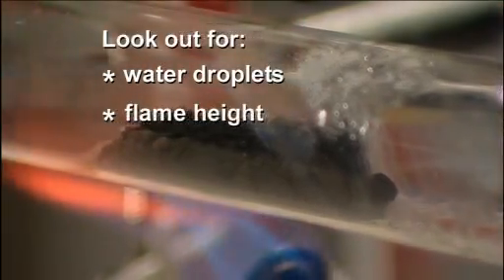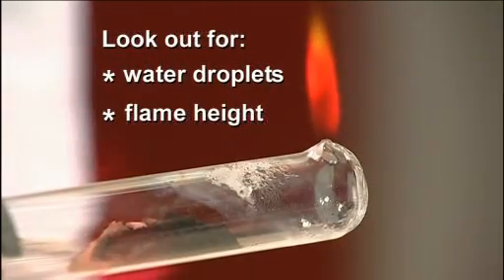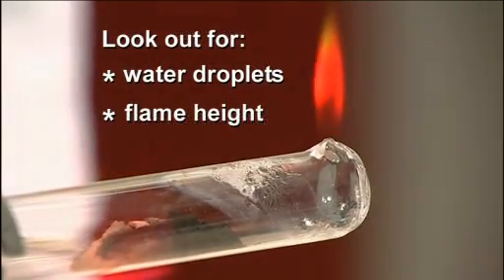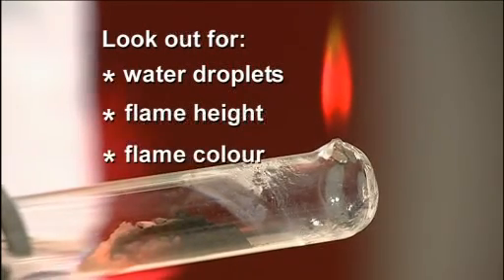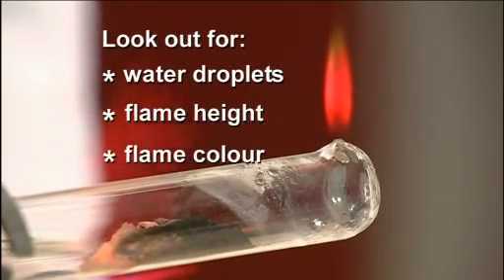The height of the flame will drop as some of the hydrogen is used up, reacting with the oxygen in the copper oxide. The flame may develop a green coloration caused by copper atoms vaporized into the flame.